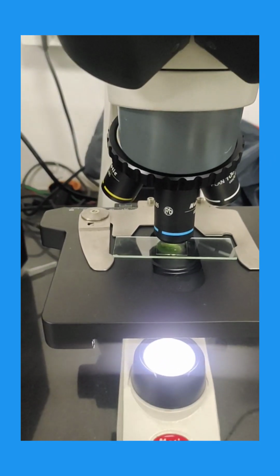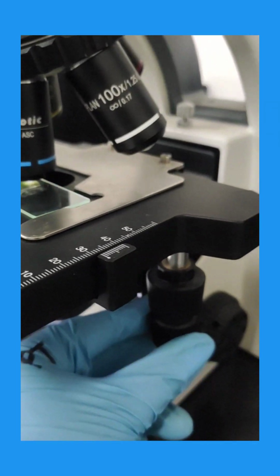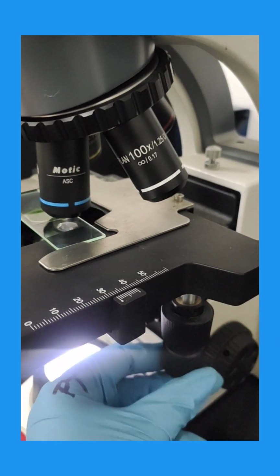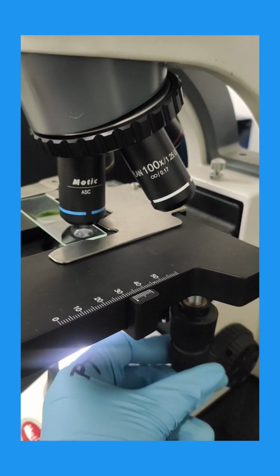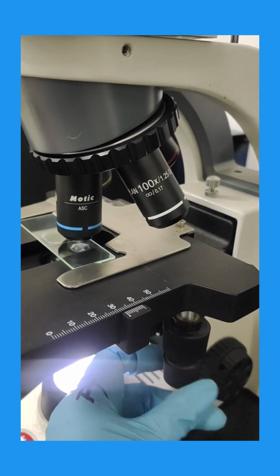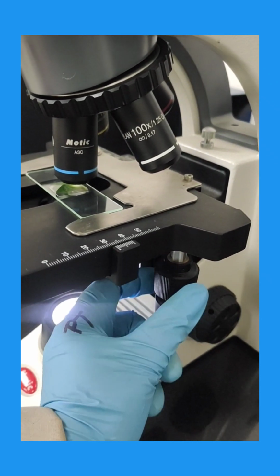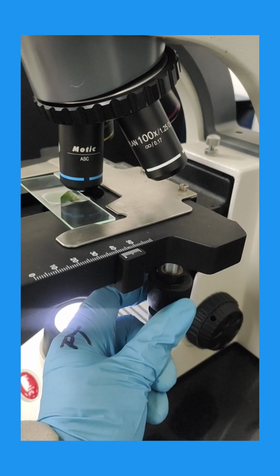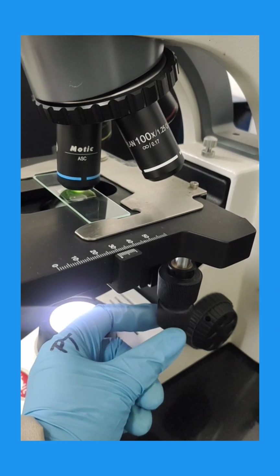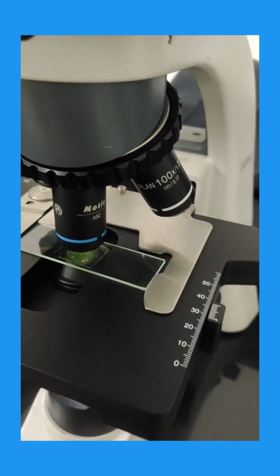So this is a binocular eyepiece. There is the knob. This knob is used for changing the position of the slide holder from left to right or from right to left. There is another knob which will move the slide holder backward and forward. So there are these two knobs for adjusting the position of the slide on the platform.